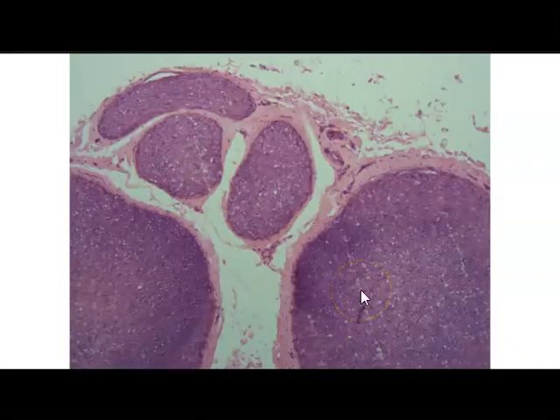And here, this shows you the peripheral nerve and its different coverings. So make sure you're comfortable identifying the different coverings. The outer, of course, being the epineurium. Then you have the nerve fascicles, and they're surrounded by perineurium, and then you have the individual axons that make up the nerve fascicles, and those are surrounded by endoneurium. So outer epineurium, middle perineurium, and then inner endoneurium.